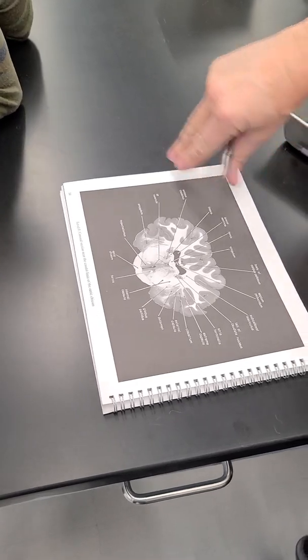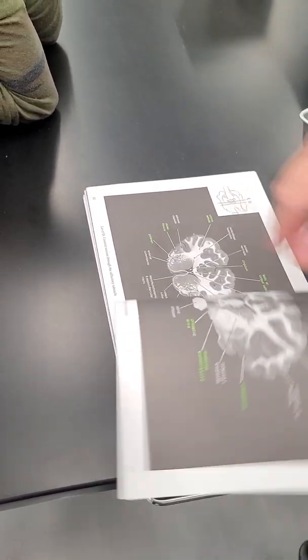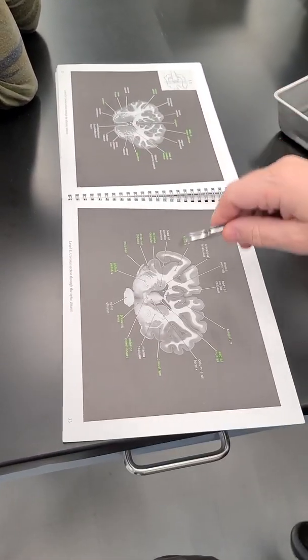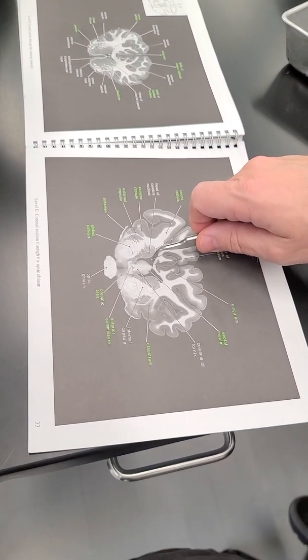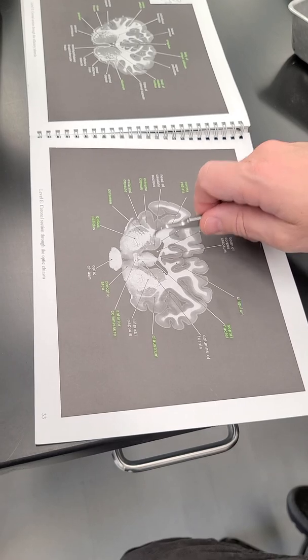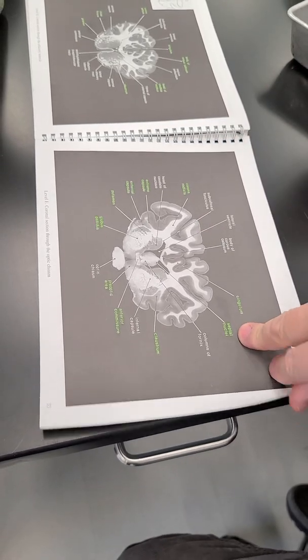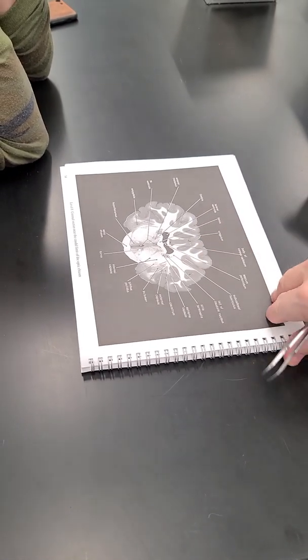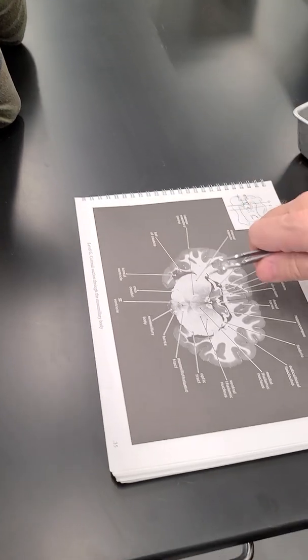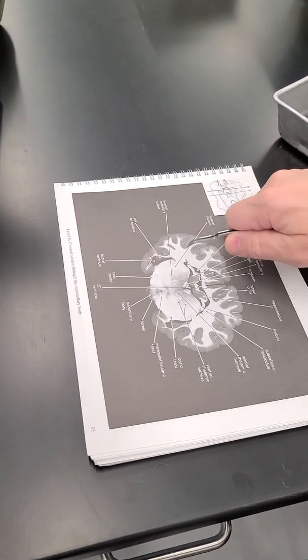You can see the caudate nucleus start out in the forebrain pretty large as the head of the caudate, and it's right next to, just lateral to, the lateral ventricle. And then as you move caudally, it narrows down to form the tail. And the tail also is proceeding caudally at the edge of the lateral ventricle.